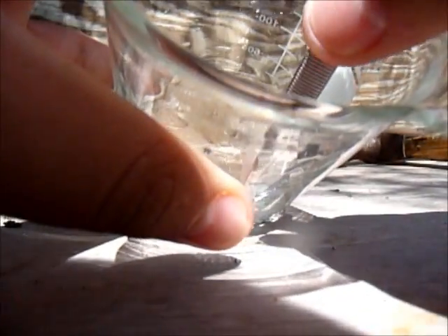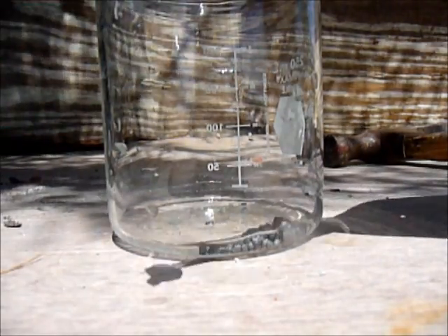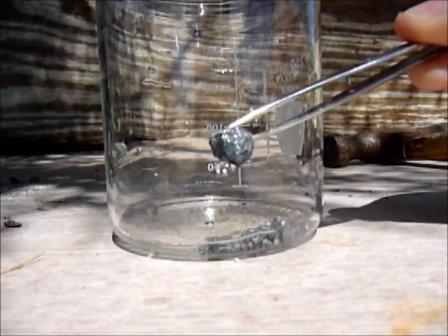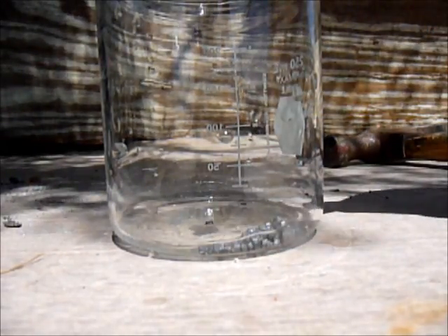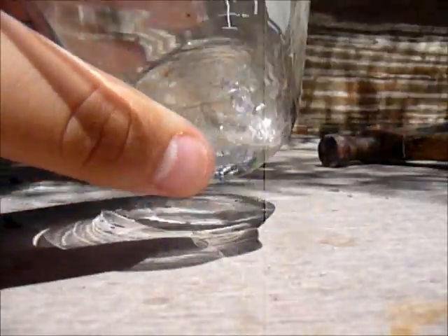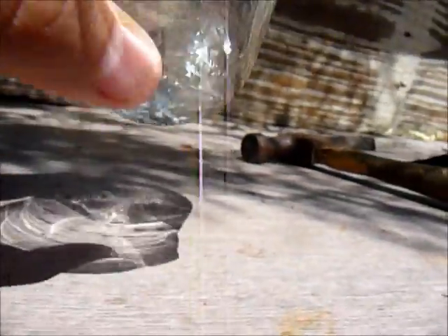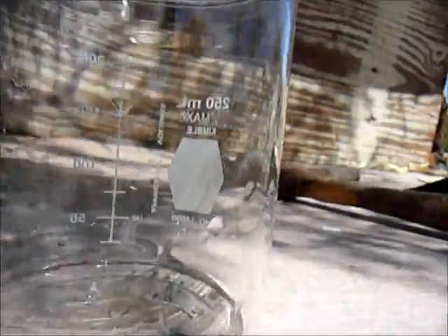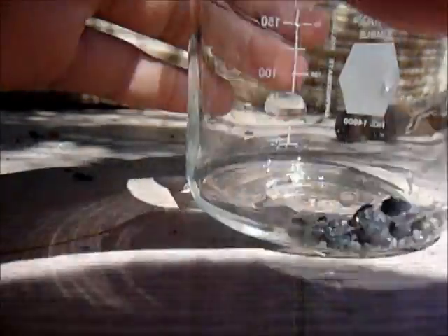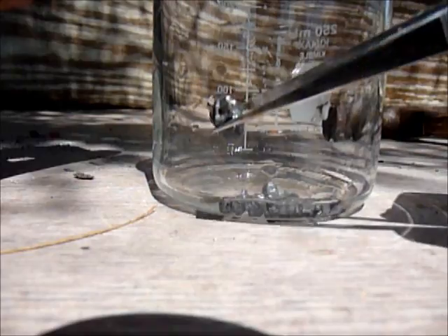This is pretty awesome. Last time that I tried this, I even got low results. I actually got big pieces like this. You can actually see that it's very shiny. This is everything that I got. I'm actually pretty proud. Last time that I did this, about a month ago, I received little crystals, but this is awesome with this big chunk of silicon that I received.